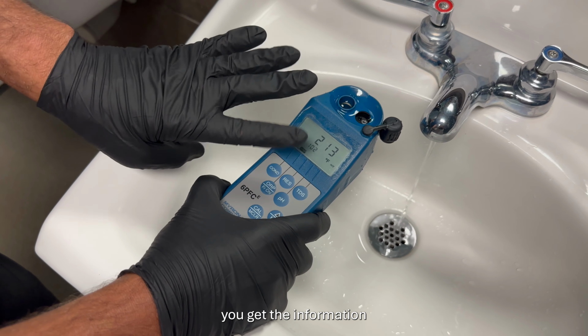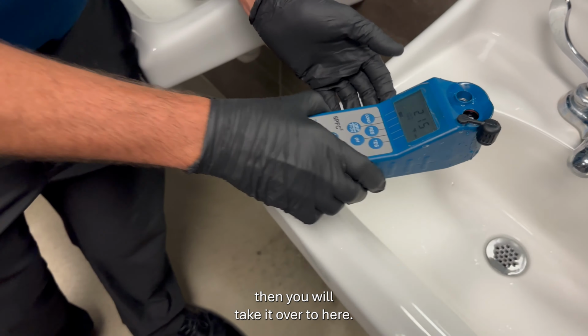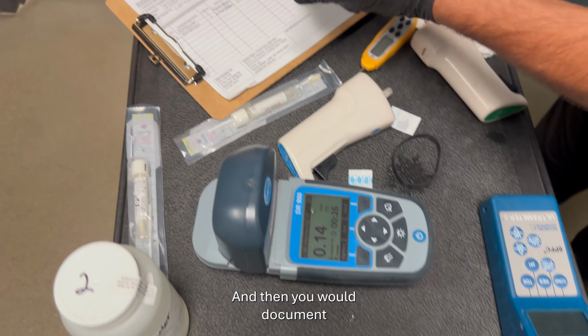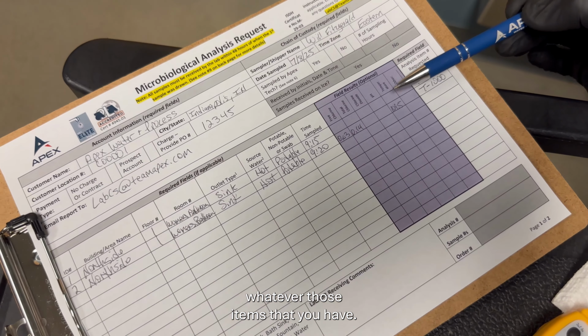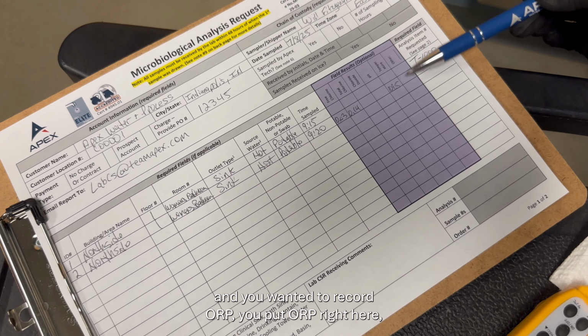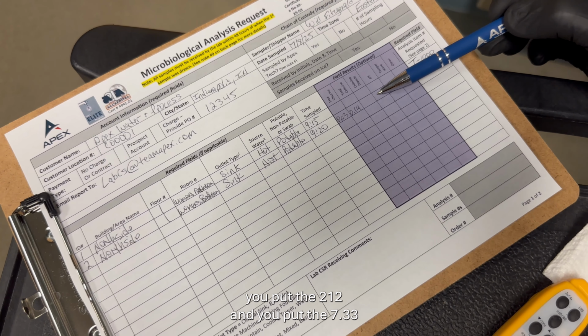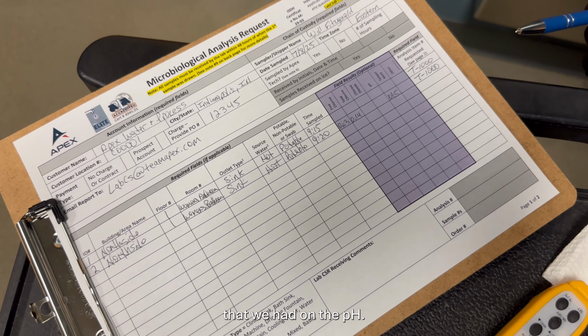And then once you get the information of the items that you want, you will take it over to here, and you would document whatever items you have. Let's say you wanted to record pH and you wanted to record ORP. You put ORP right here, and you put the 212, and you put the 7.33 that we had on the pH.